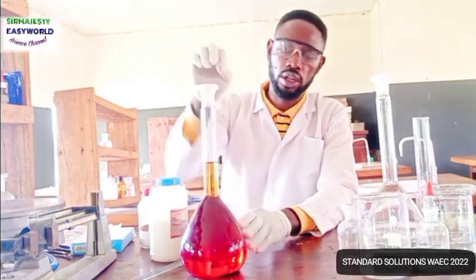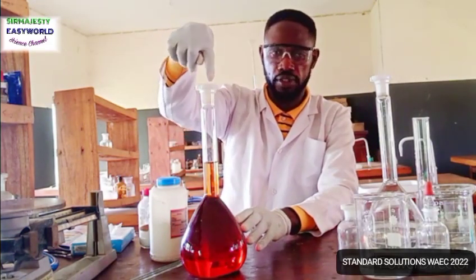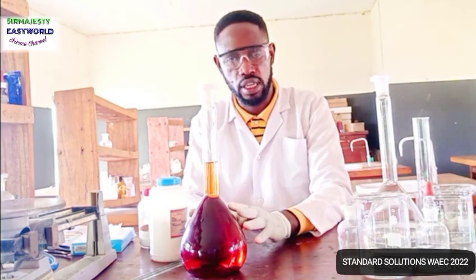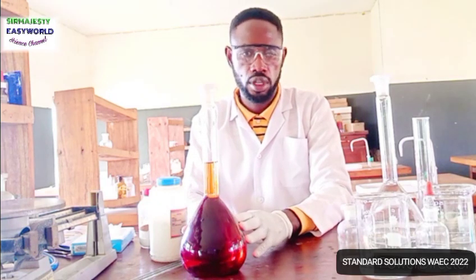So this is our solution A. And remember, I'm going to discard this immediately after this video. Otherwise, if I keep this for just 2 days, the whole cork that you see, very neat now, will turn reddish brown. Iodine is very stubborn and stains everything that comes its way. It's volatile, it's reactive, just like halogens, of course. So be careful. And I say again, prepare this very early in the morning before the exam, on the exam day. Don't prepare this a day before or 2 days before, because definitely even consecutive titrations will vary so much.